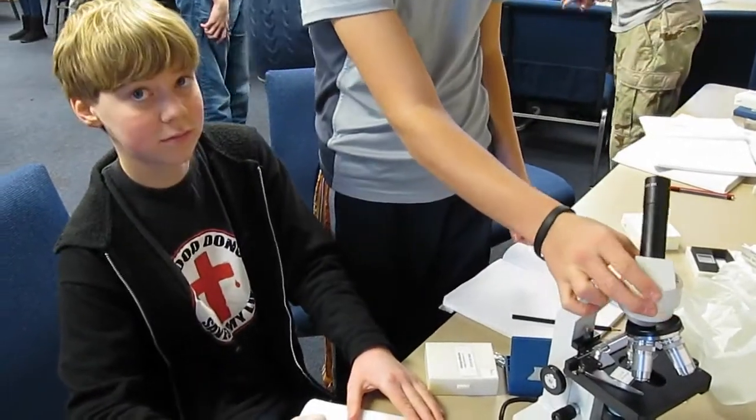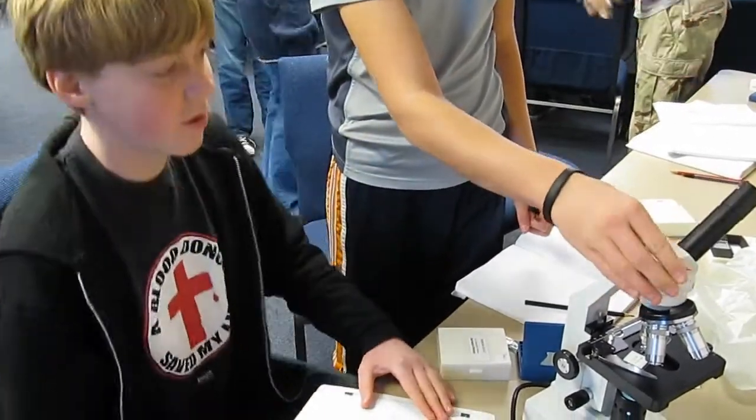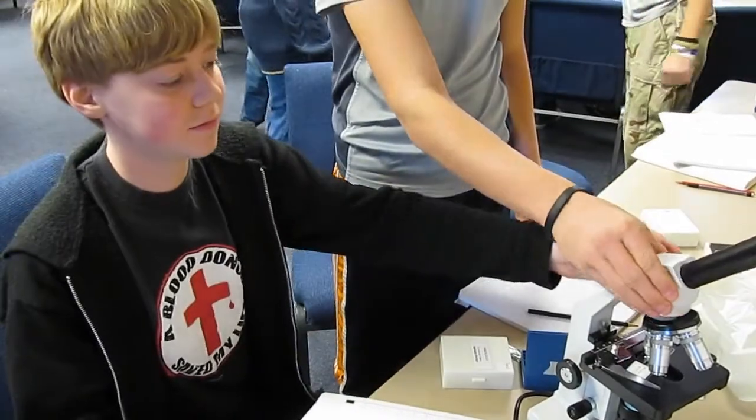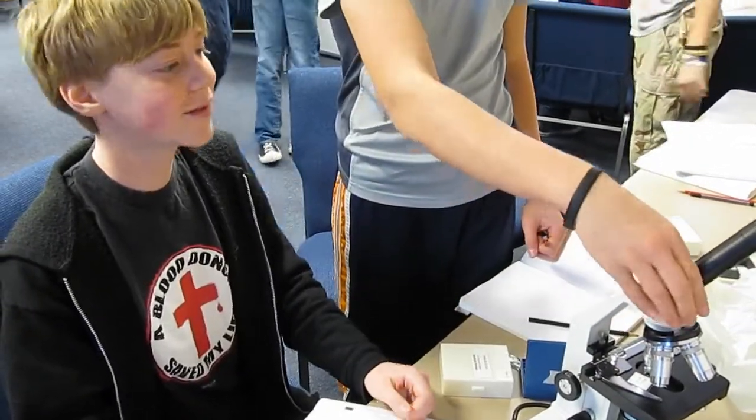Are you supposed to turn this on? You can turn it whichever way you want. You can't see it from that direction, though. Whichever side, you can spin.